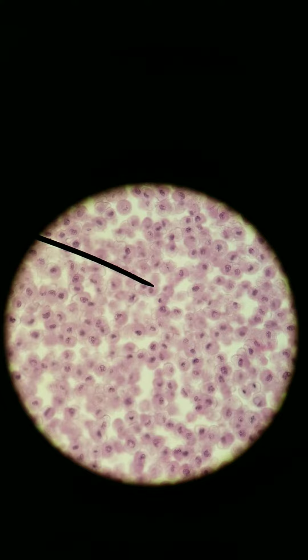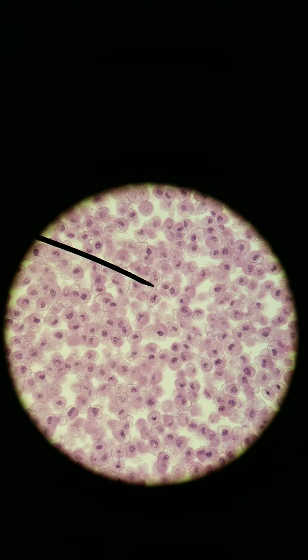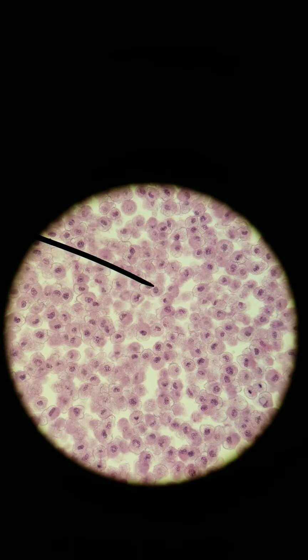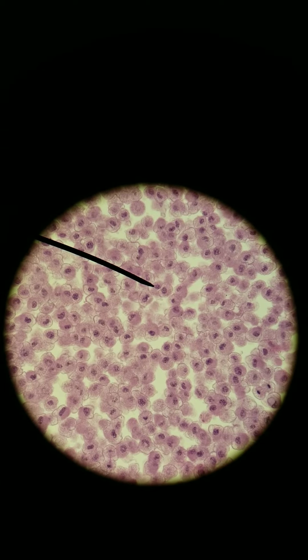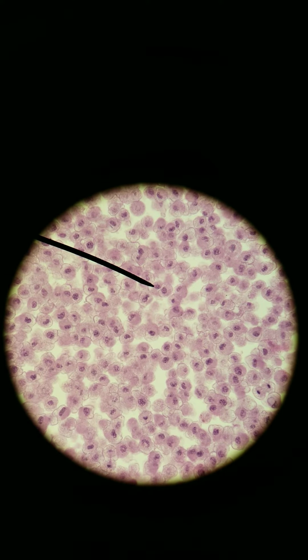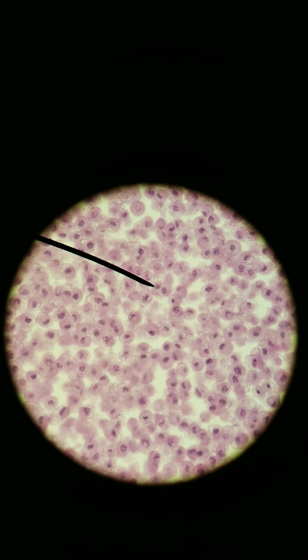Great. Okay. First, the arrow. These two cells that you see right at the arrow, this one cell here, this one cell here, the nucleus is there, it's prominent, it's outlined, and you can't see any distinct structures within the nucleus. It's pretty fuzzy. These are in interphase, so they're not in mitosis, they're not dividing. Ones that are dividing, you can see the chromosomes distinctly. So one that I can find really easily, I'll go in order. Okay, so here you can't see them very distinctly.